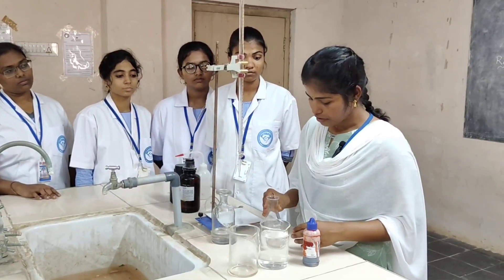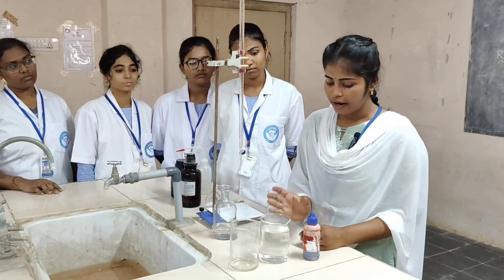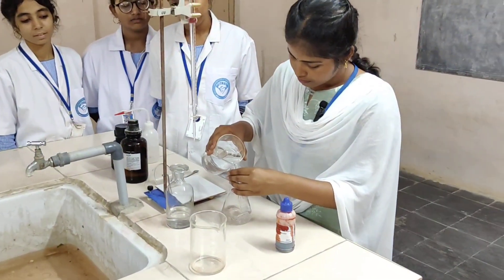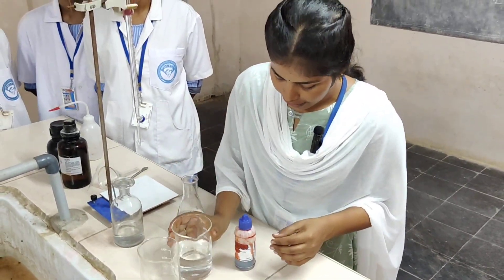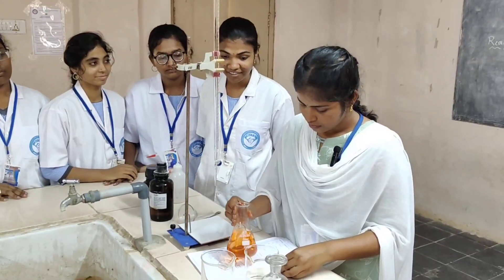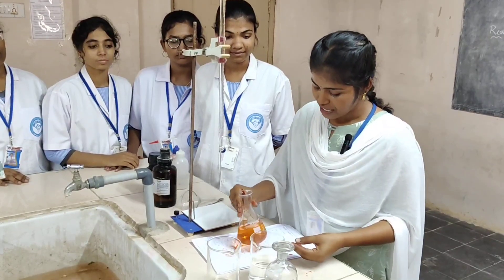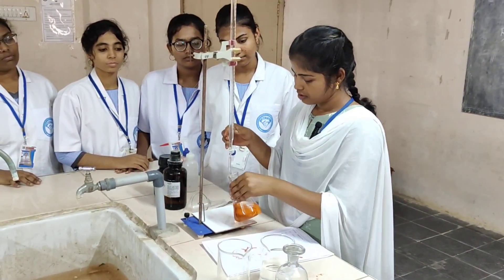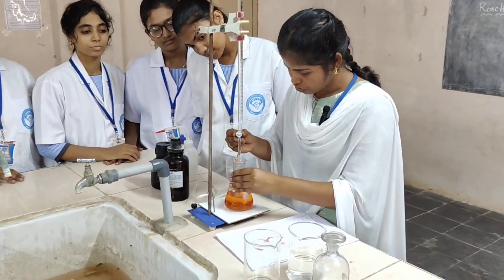Now take a conical flask and add 20 ml of standard solution, and add 100 ml of distilled water. Then add 2-3 drops of methyl red, which is used as an indicator. Then pour it into the burette and add some drops of sample solution.